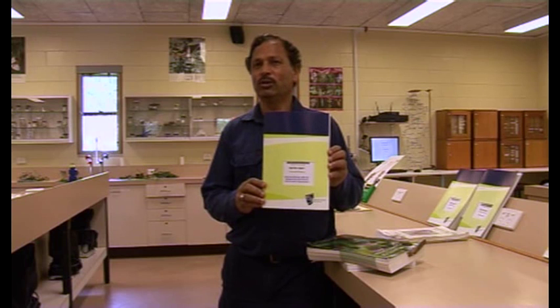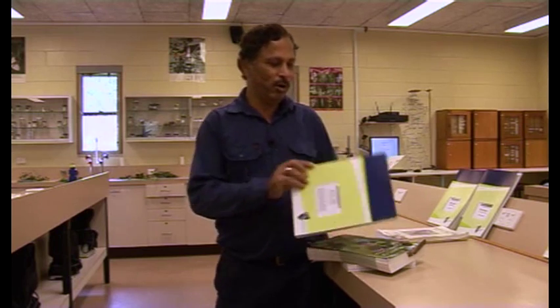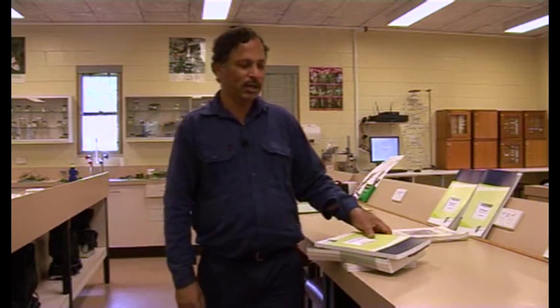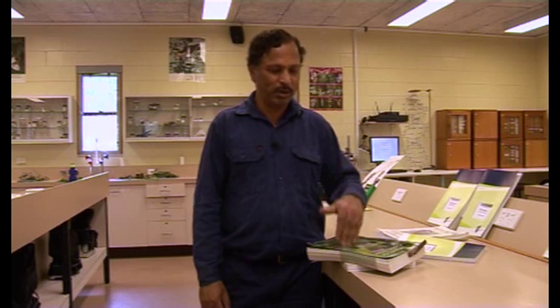Then you are almost sure that the specimen you have collected belongs to that particular genus. The important thing is you need to collect the sample, familiarize yourself with that specimen to a basic level based on the local books, and then collect the information to prove that that specimen belongs to that particular genus in the family. The proof is the one which is necessary rather than just giving the name. Anybody can look at the color of the plant and the flower and compare that with the local book and write the name, but they may not be sure whether it belongs to that particular genus.